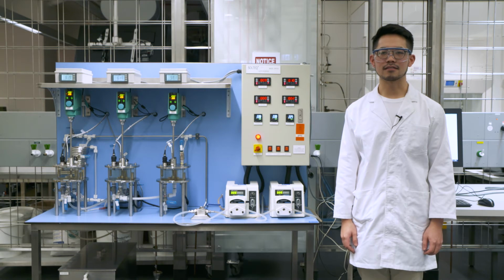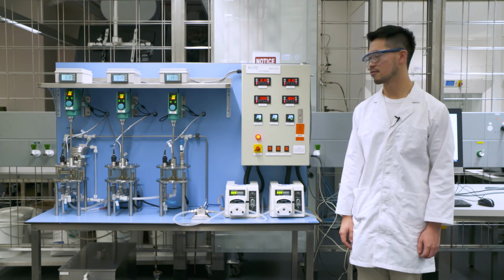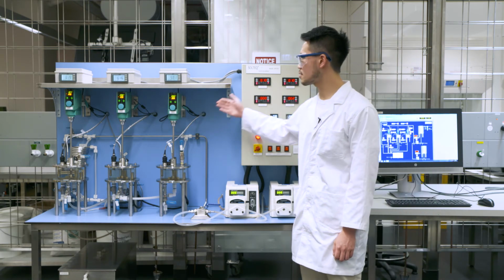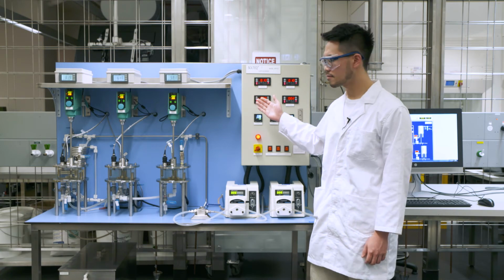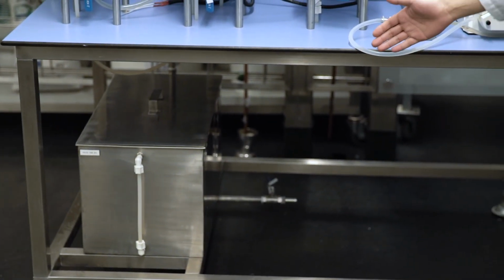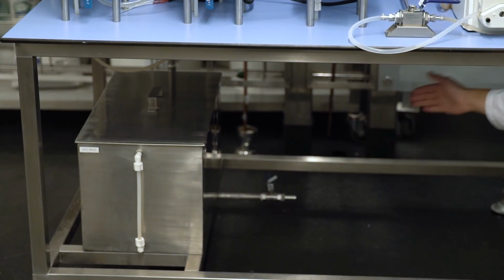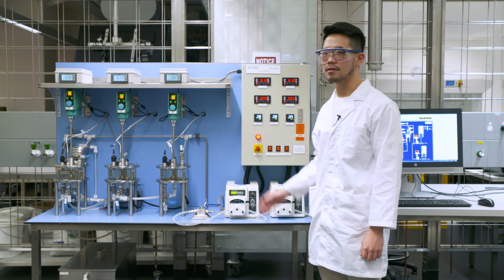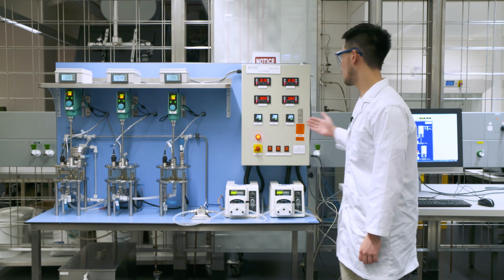After the experiment, you need to open all the valves from V11 to V18 and close the pumps and the stirrers at the same time. You need to rinse the whole system with cleaning water and then let it go through the waste tank. After that, you need to drain the tank into the hole at the back side. Then you can switch off the main power and record your data from your computer.